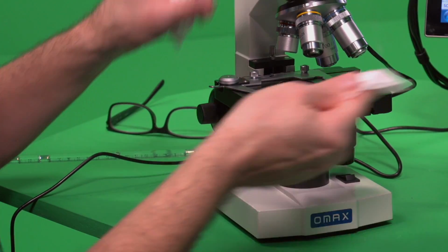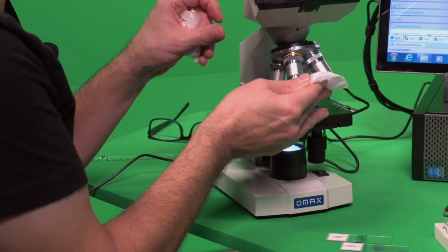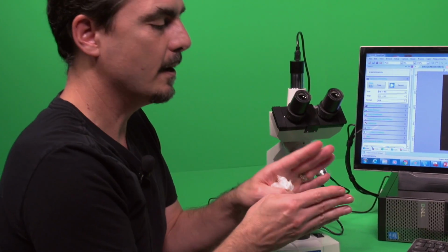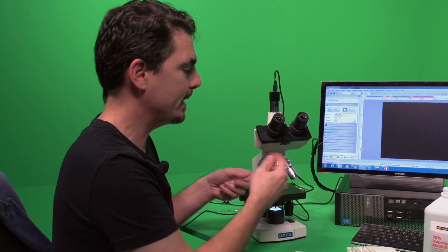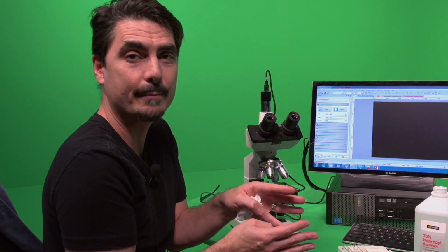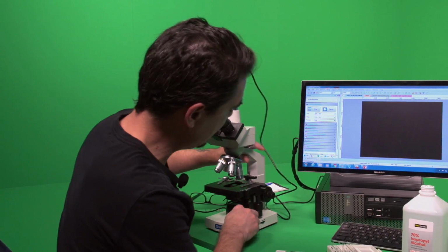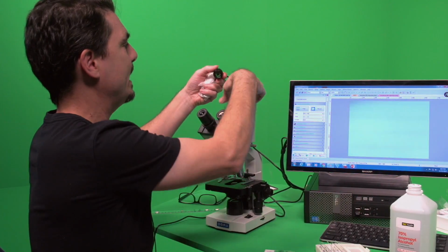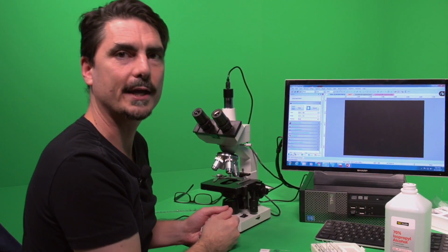Now what I don't want to do is put alcohol on the objectives. Do not do that. If you get too much alcohol in there, the lenses are actually thin pieces of glass that are fused together, and they use some type of adhesive in there, and if you use a bunch of alcohol, it can start pulling out and delaminating it, which you don't want. Okay? So when you're done cleaning it off, it's always a good idea, this came with a cap, you could put a cap on there, or you can just put your little plastic hood over the whole thing when you put it away.